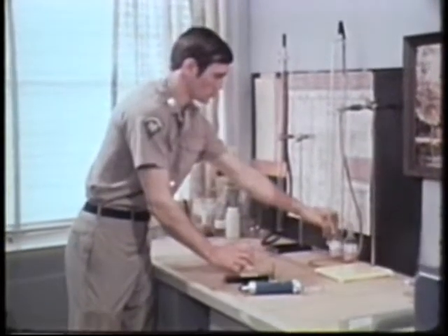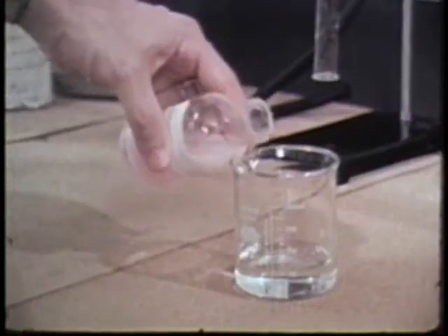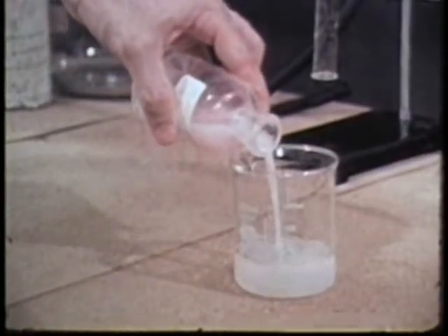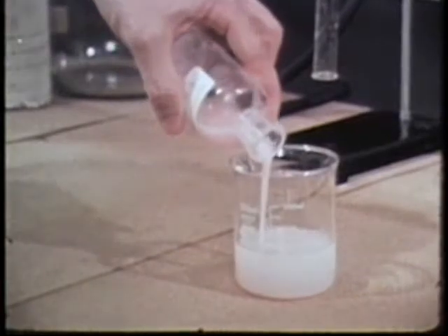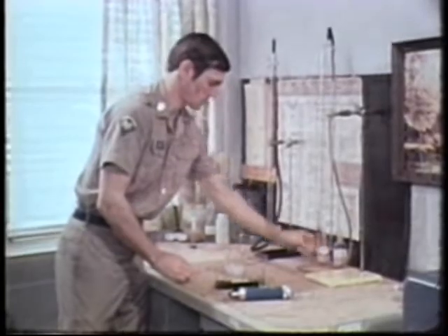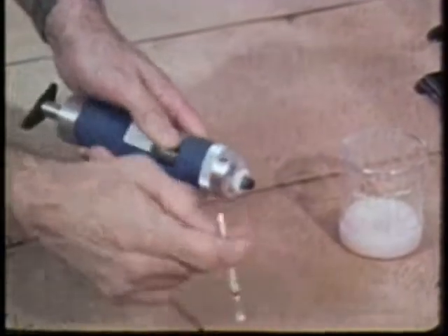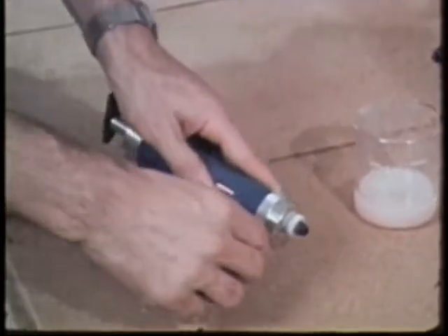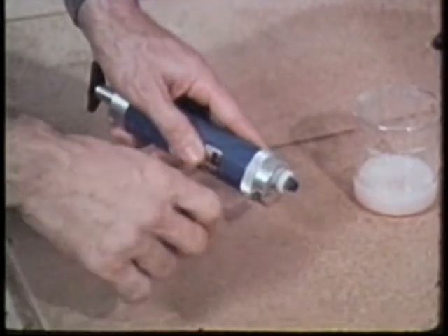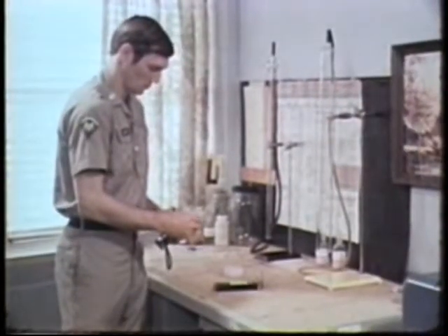You should also periodically check the volume of the pump. To do this, you make up a solution of half water, half liquid detergent. To prepare the pump for the volume test, break off both ends of a detector tube and insert the detector tube into the pump.